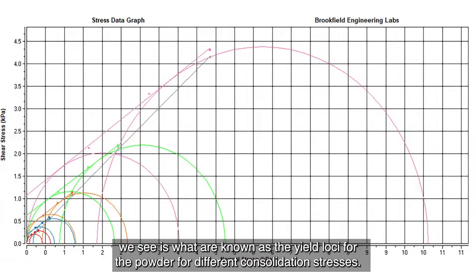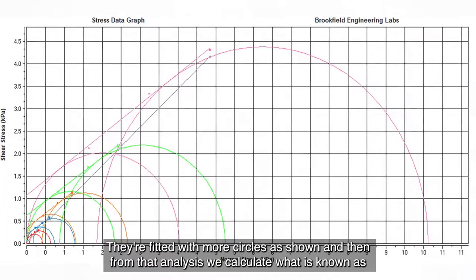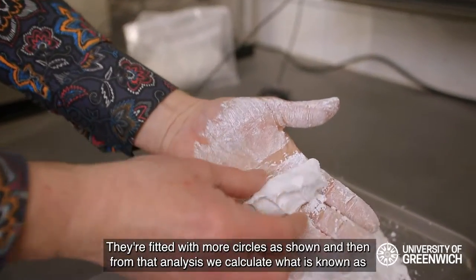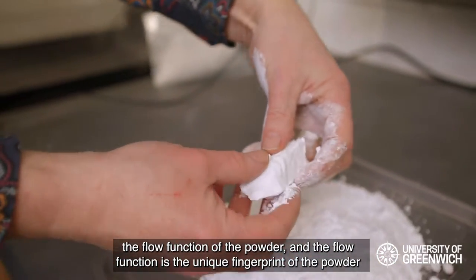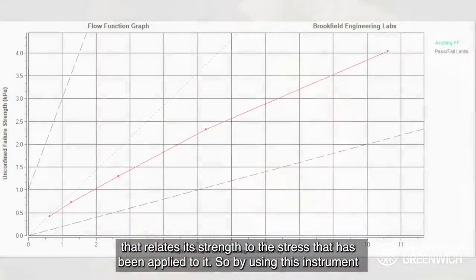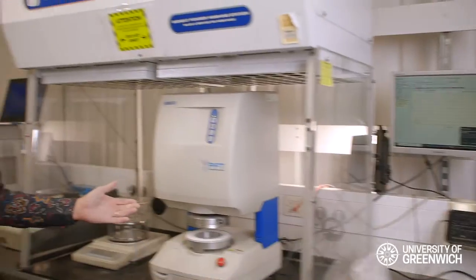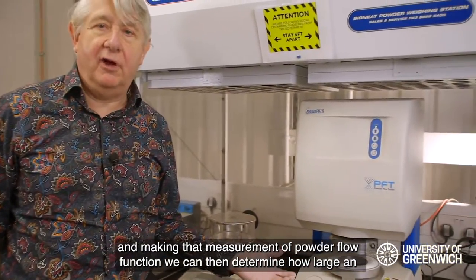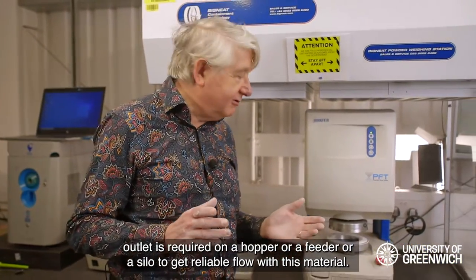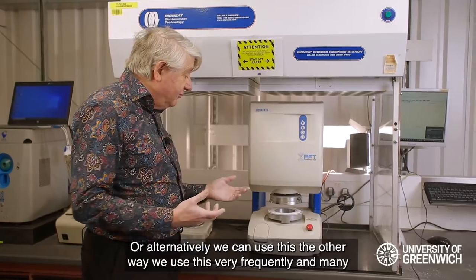What we see on the graph are what are known as the yield loci for the powder at different consolidation stresses, fitted with Mohr circles as shown. From that analysis we calculate what is known as the flow function of the powder — the unique fingerprint of the powder that relates its strength to the stress that has been applied to it. By making that measurement, we can determine how large an outlet is required on a hopper, feeder, or silo to get reliable flow with this material.